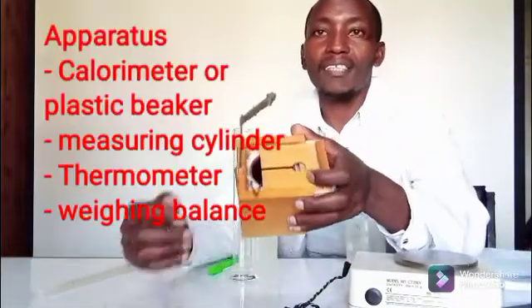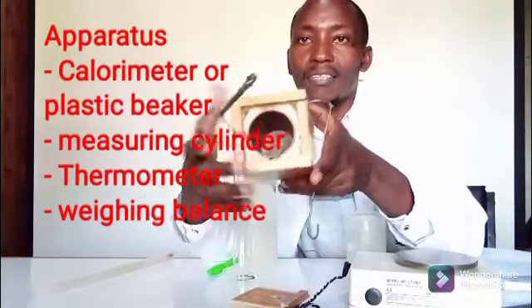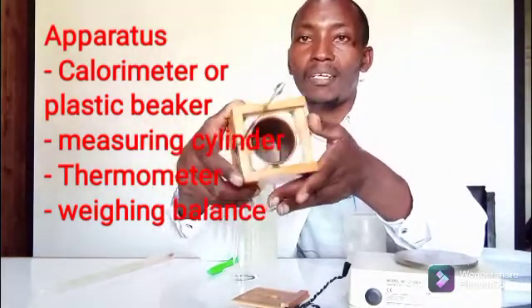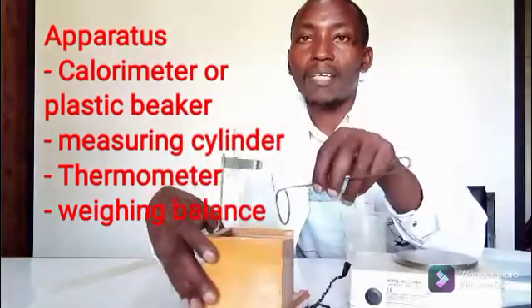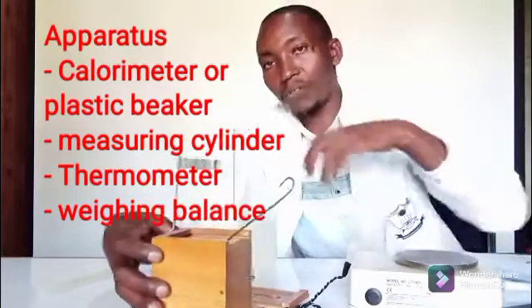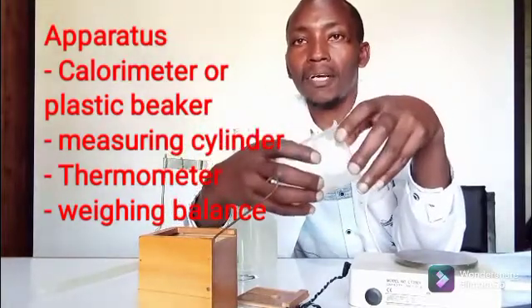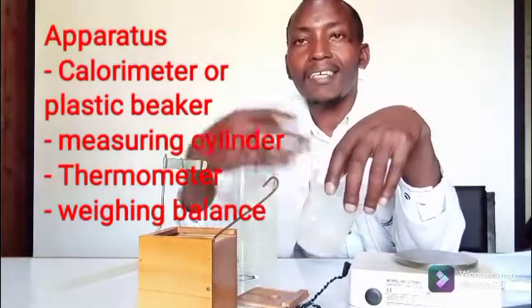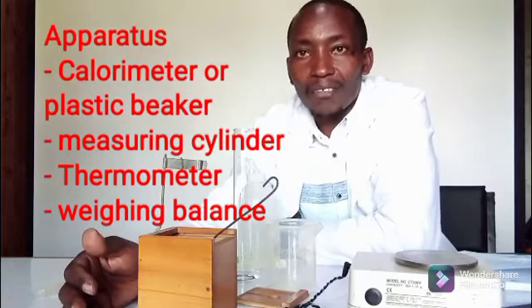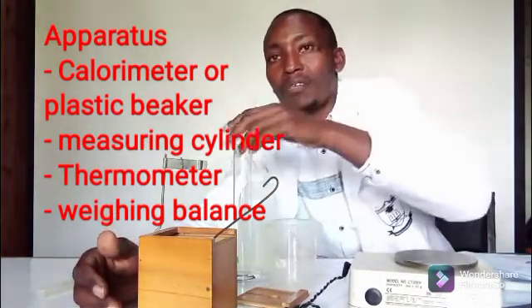I'm going to use a gadget called a calorimeter. You can see how it is — it has a container that is well insulated with cotton wool, and that is where the reaction takes place. In case you don't have a calorimeter, you can use a plastic beaker wrapped well with tissue paper, ensuring it is well insulated so that you minimize the loss of heat.